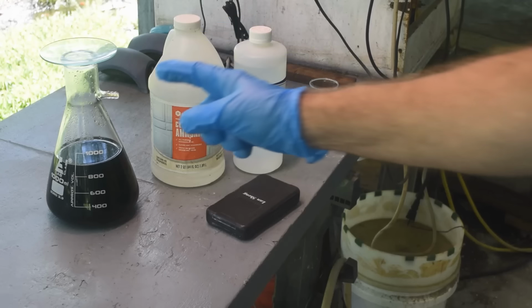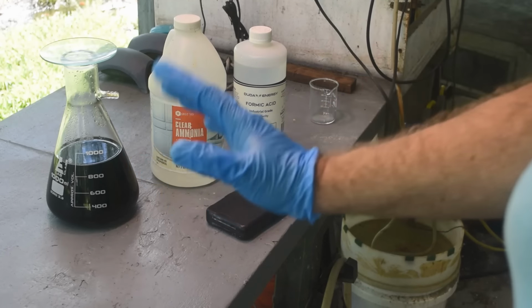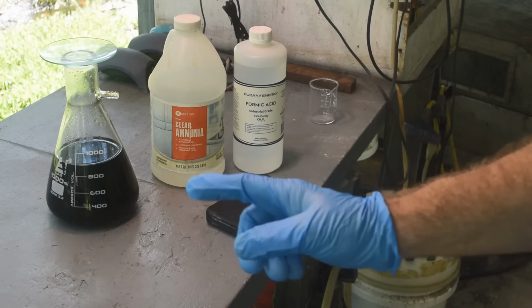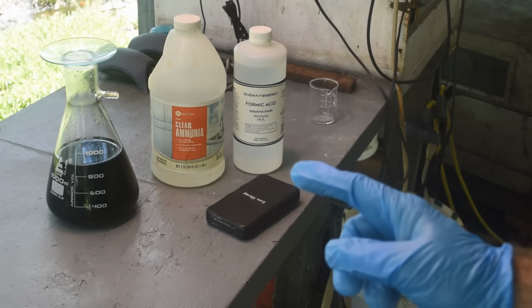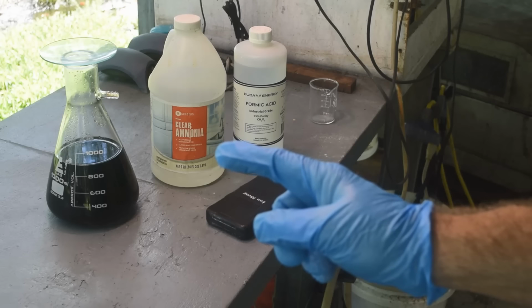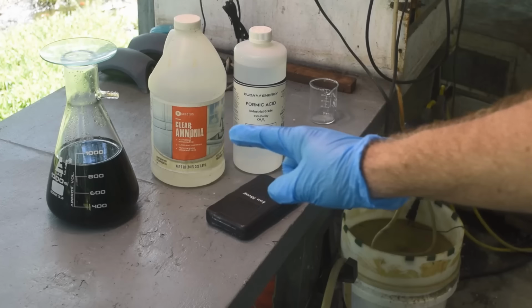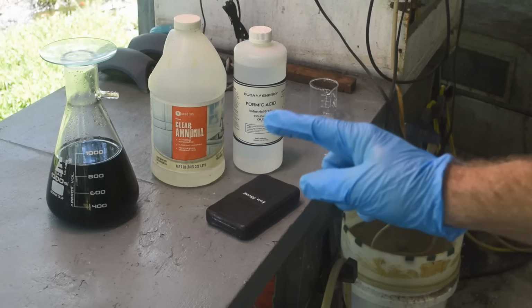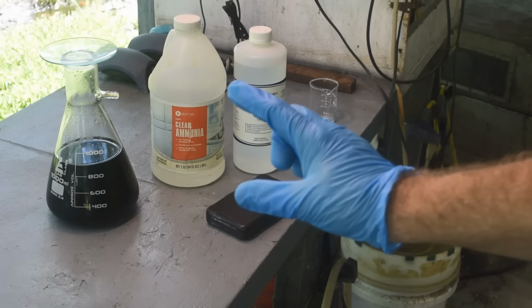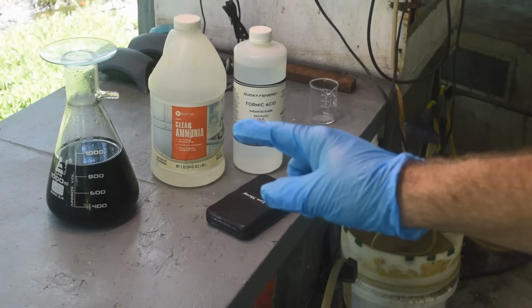Okay, so now we've got our nice filtered solution of palladium ammonium chloride here. Now we need to reduce it to metal. And how are we going to do that? We're going to use the ammonium formate method. But first, make some ammonium formate using formic acid and household ammonia. Now you want clear ammonia. You don't want sudsy ammonia. You don't want lemon fragranced ammonia. You don't want any kind of ammonia other than just clear ammonia. And the stronger, the better on this stuff, okay?